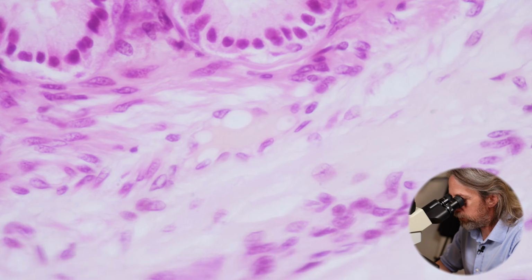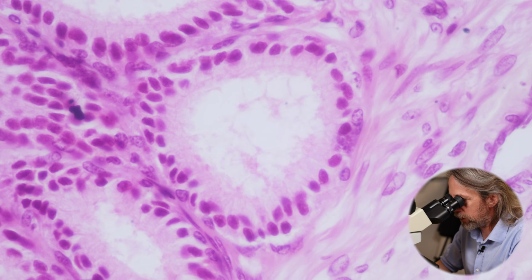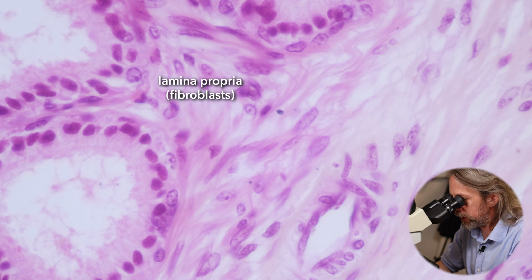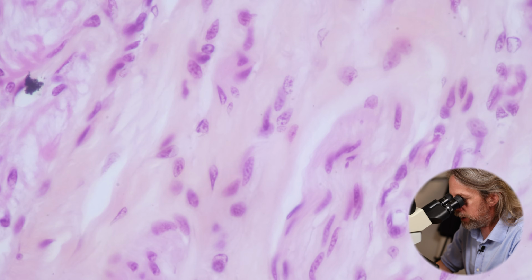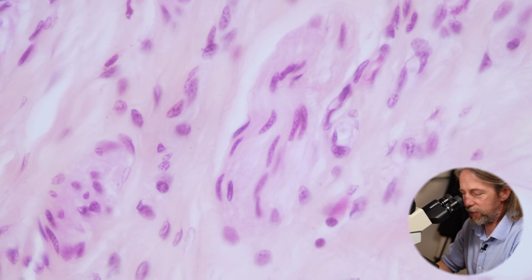Anywho, slide across and look. What we're looking at here is there's a lamina propria, a connective tissue supporting the epithelia, which is running around all of these tubes and holding it all together. And as we go out here, look at these guys, that looks great. See those wiggly cigar-shaped cells?